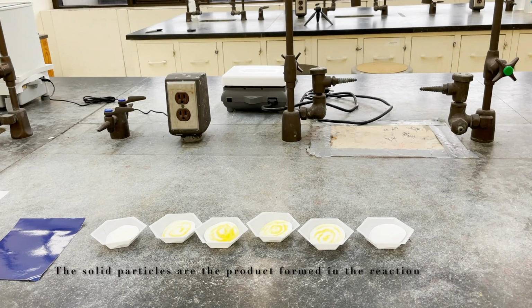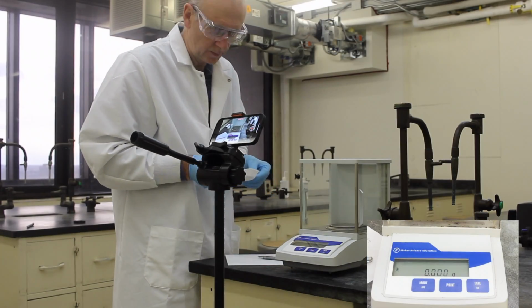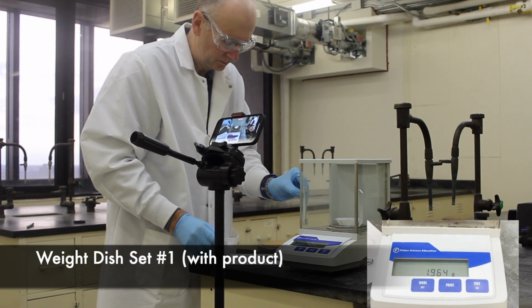After you're done with the last filtration, set them to the side and give them a few minutes to dry. Use this time to clean up. Lastly, we will measure the mass of each set of weighing dishes.